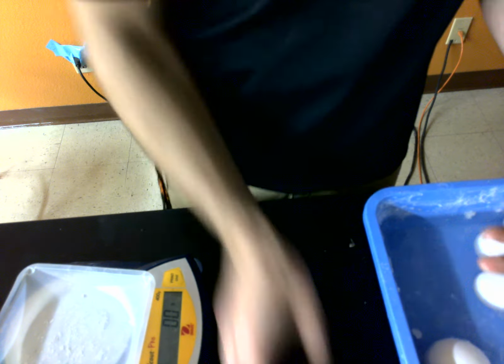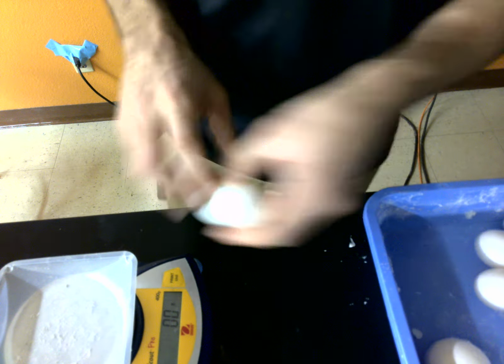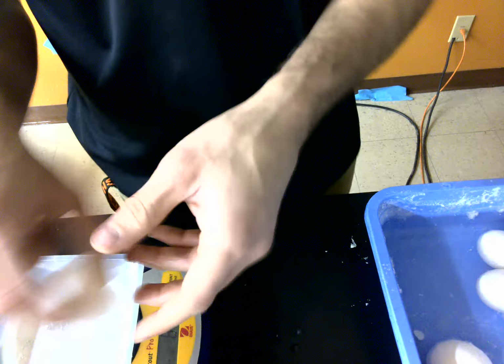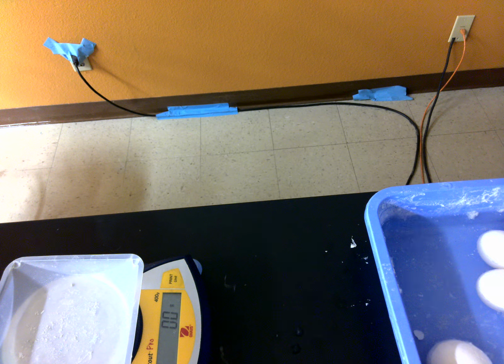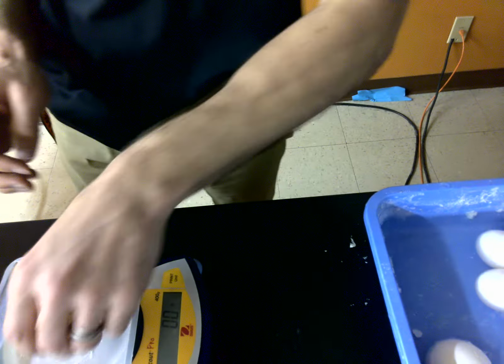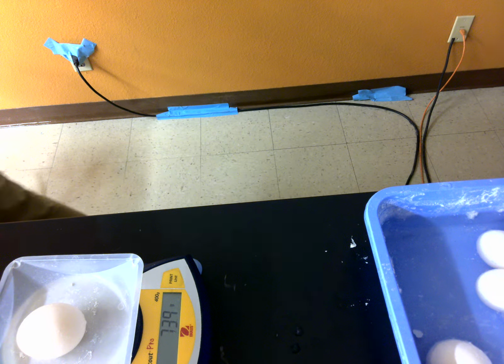What we need to do first is we need to measure them. So this is the data you guys are going to take. So I'm going to zero the scale. I think we can see the scale. We're going to put that on. So egg 1 is 60.6 grams. Write that down. I will too. Egg 2 is the 100 gram per liter solution, and it is 73.9 grams.